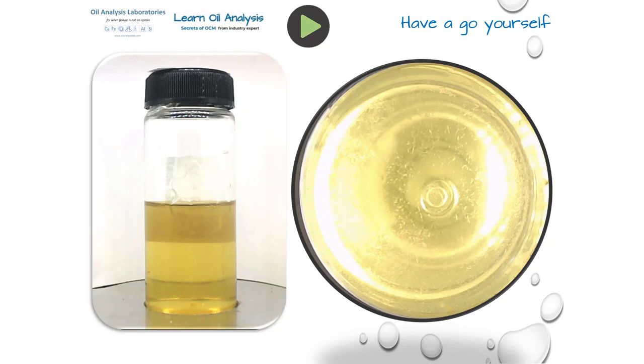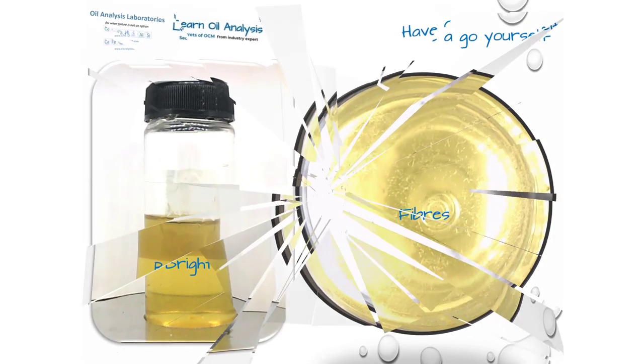Firstly, this first sample, the fluid is bright, but there is a frost effect at the bottom of the bottle. These are usually paper fibres from a paper towel used to clean around the sampling point, or in this example, the customer is manufacturing paper, so this is actually environmental contamination from around the machinery. This next one is ready for you to have a go now.